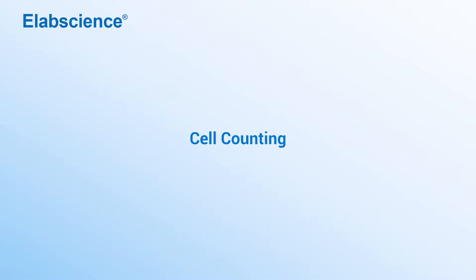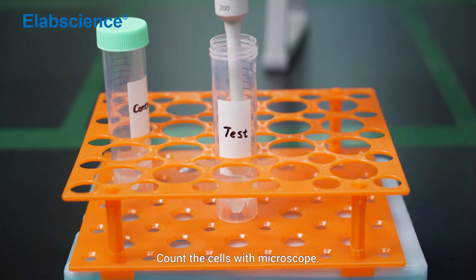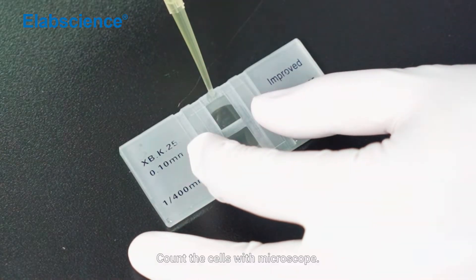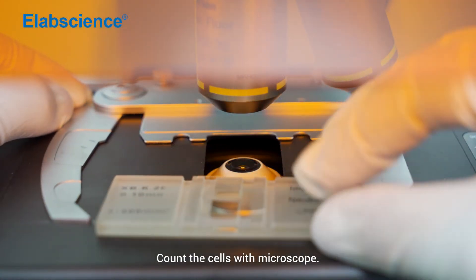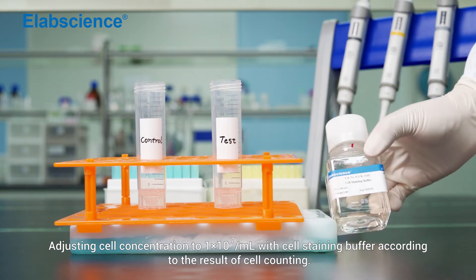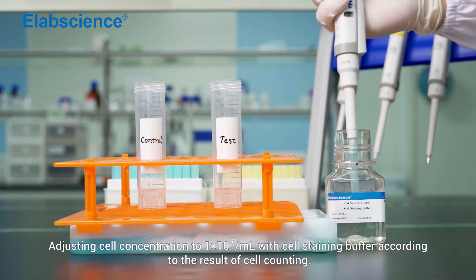Cell counting. Count the cells with microscope. Adjust cell concentration to 1×10⁷ per mL with cell staining buffer according to the result of cell counting.